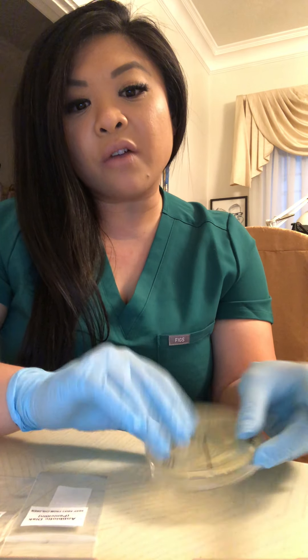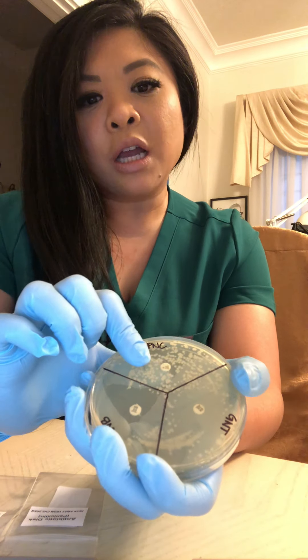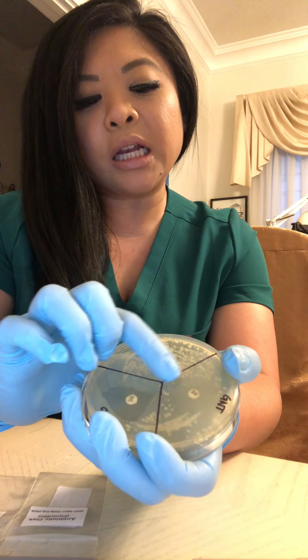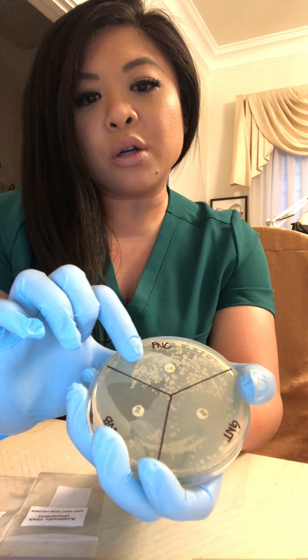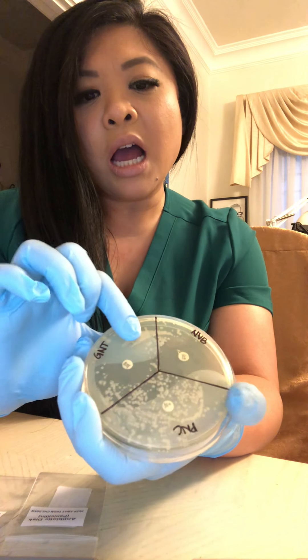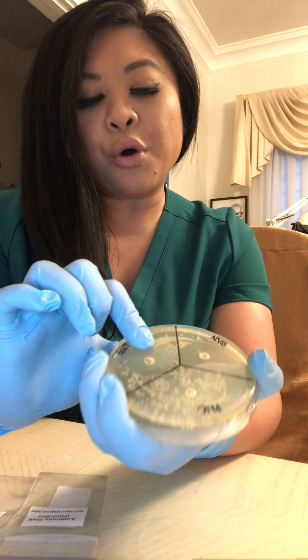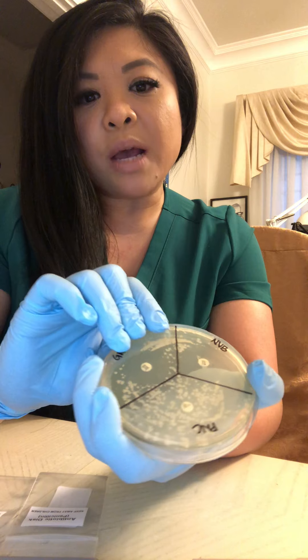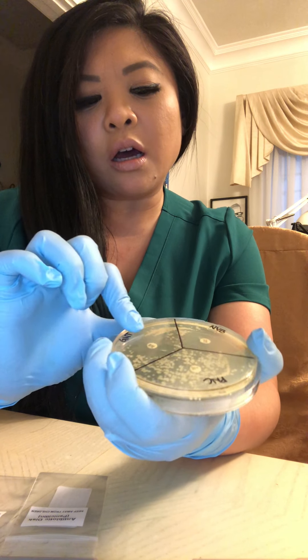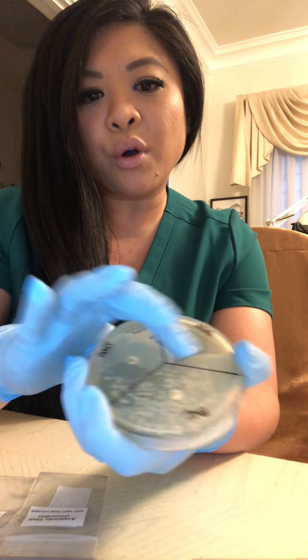I was actually expecting penicillin to be the most effective of the three antibiotics, considering it is a narrow-spectrum, gram-positive, and bactericidal antibiotic — meaning that it will kill anything in its way that grows within its target parameters. The other two, novobiocin and gentamicin, I was expecting them to have similar growth suppression, because they are both bacteriostatic — meant to find bacteria and stop it right in its tracks.